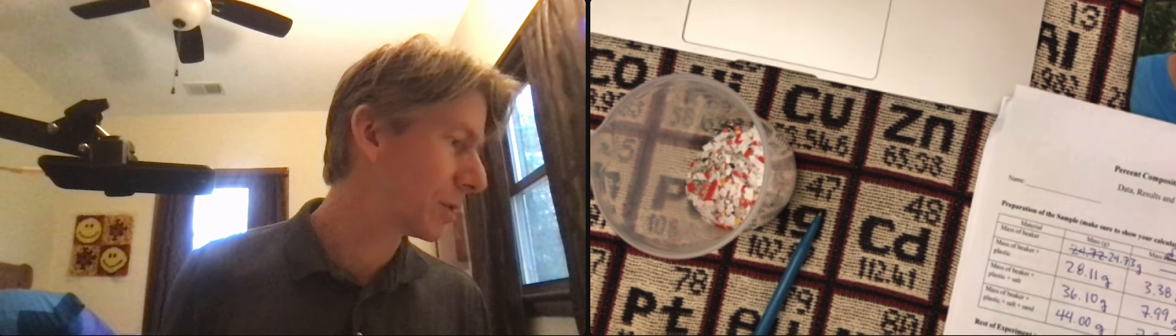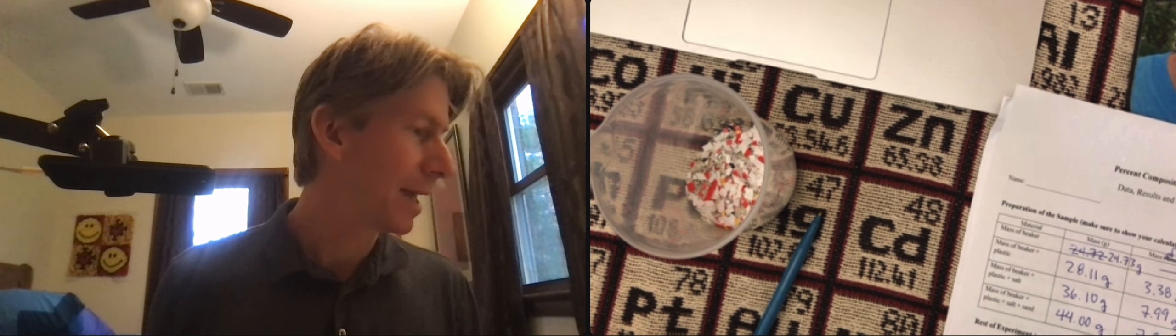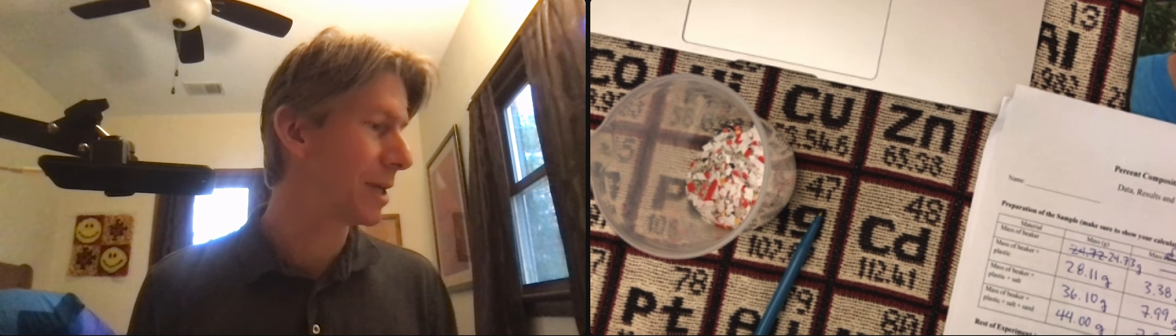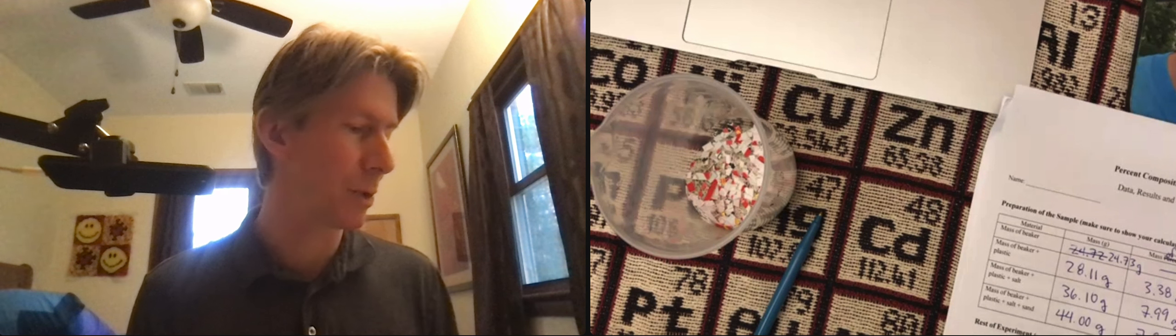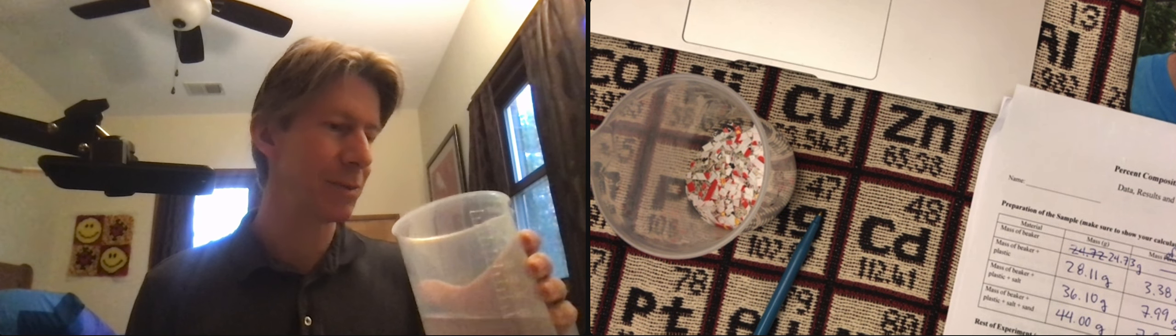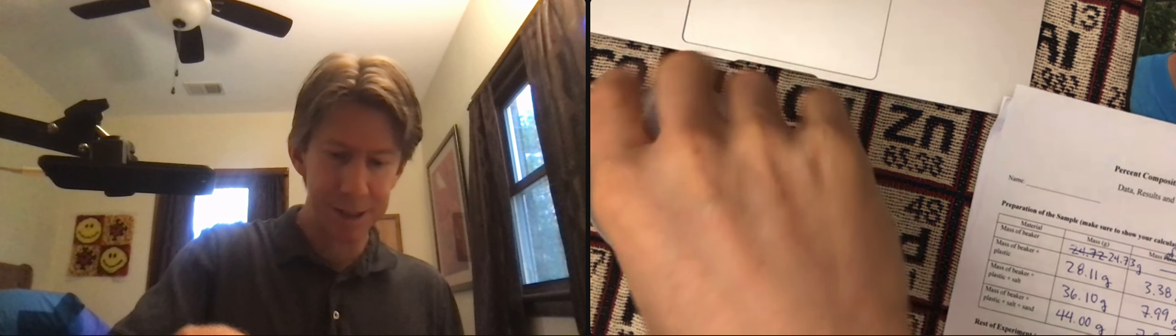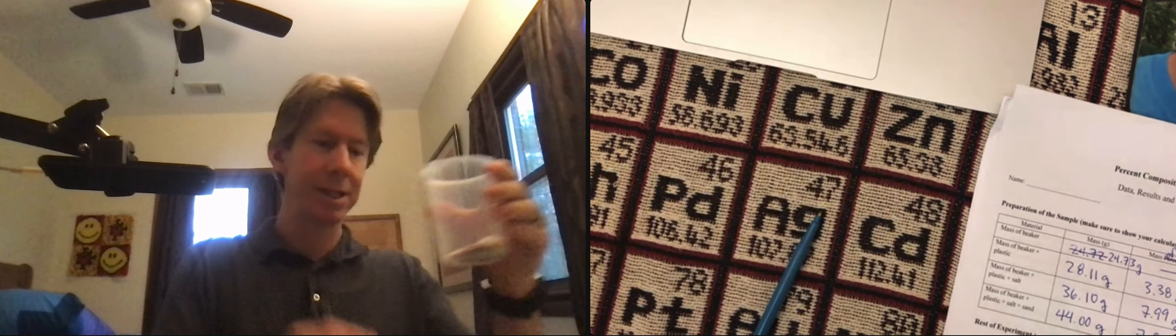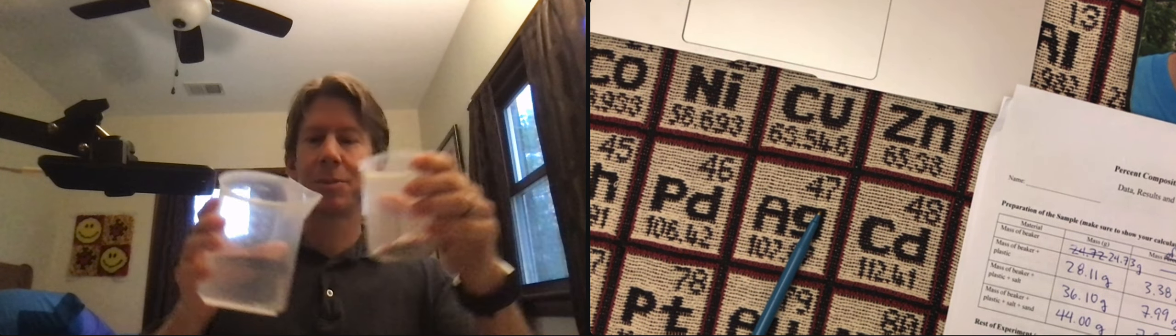then we're going to separate them. It says to the 250 milliliter beaker with the sample in it, add approximately 100 milliliters of water. I did go ahead and just get my big beaker full of water. And the exact volume is not important here, as long as it's approximately 100.